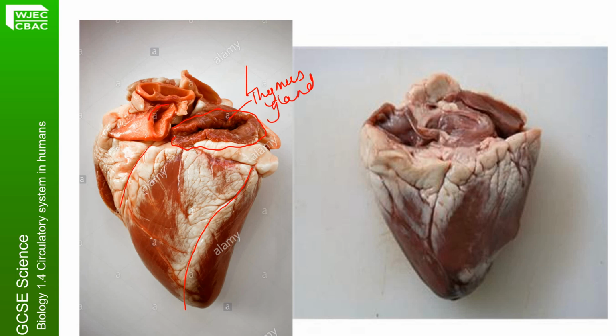And as we said, these thick, white, creamy blood vessels have to withstand very high pressure. These are the arteries. And the looser ones, probably hidden behind the thymus gland there, would be the veins. So arteries take blood away from the heart, veins deliver blood to the heart or inside the heart. On our supermarket heart that's here, we can see these thick creamy arteries have been chopped off.